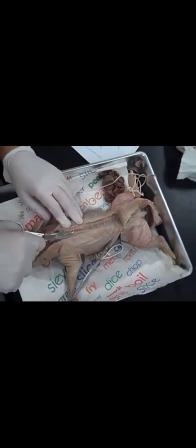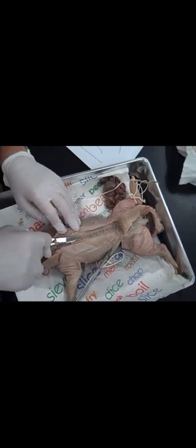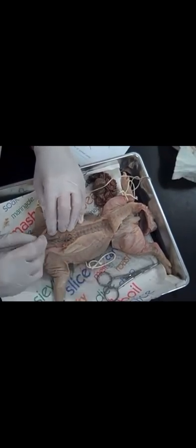After you have fully cut off the skin, make a shallow cut along the sagittal plane. Be careful so you don't accidentally damage the spinal cord. Next, take surgical scissors and snip off the bone so you can view the spinal cord. Again, this will take a lot of time and patience, so be careful while doing it. As you keep cutting deep, you will finally be able to see the spinal cord.